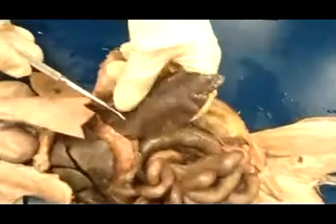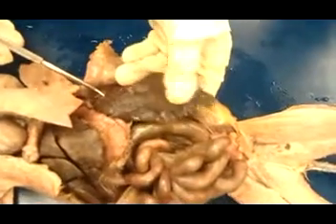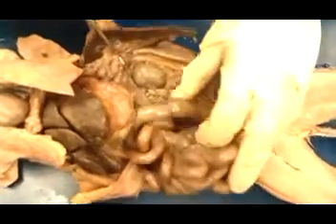Speaking of the spleen, it's on the left side. It's this dark brown, very tender organ here. On either side, we have the kidneys. So here's the left kidney, but I'm going to show you the right as well, so you can see the renal fascia. It's a little messy, but basically the kidney is almost vacuum sealed against the abdominal pelvic wall here. What holds it in place is the renal fascia. And just deep to the fascia, you can see it a little bit right there, is the renal adipose. It's just some fat that is under the fascia and on top of the kidney.